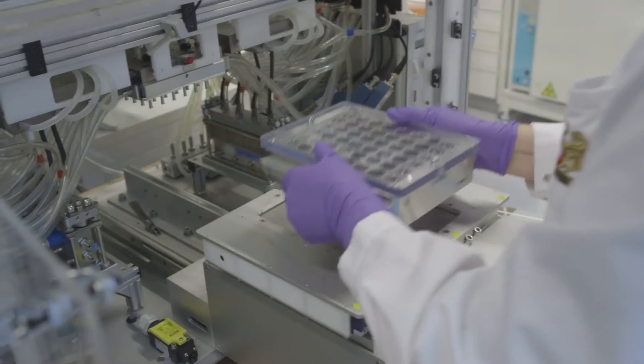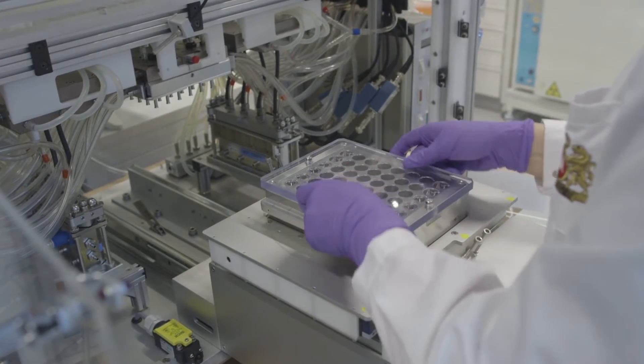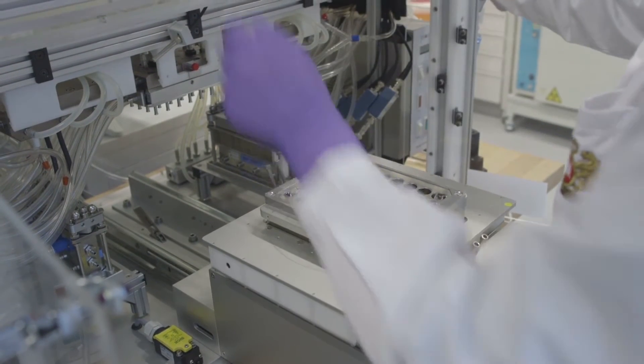The inserts are then transferred into an assay plate and placed into the vitrocell exposure incubator.